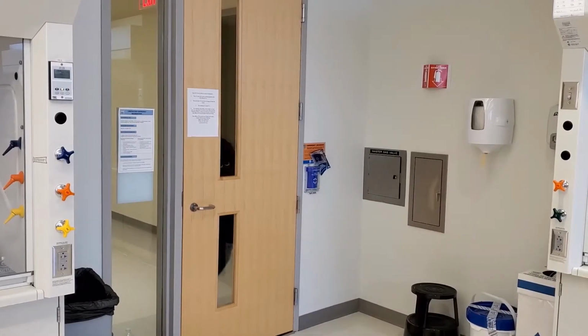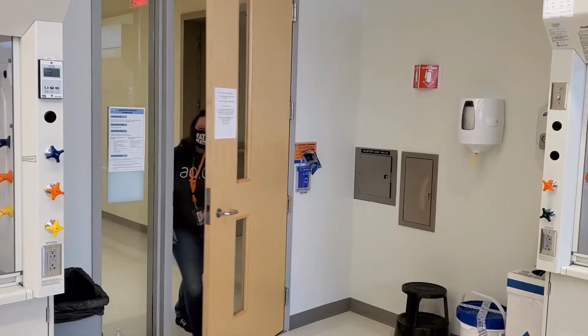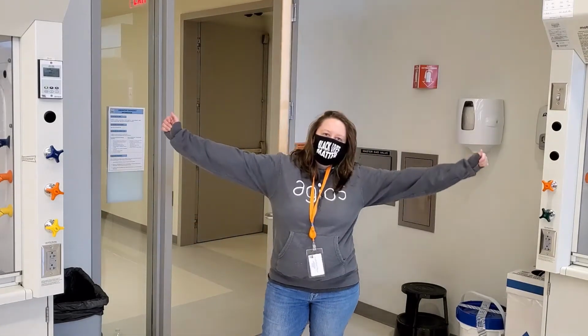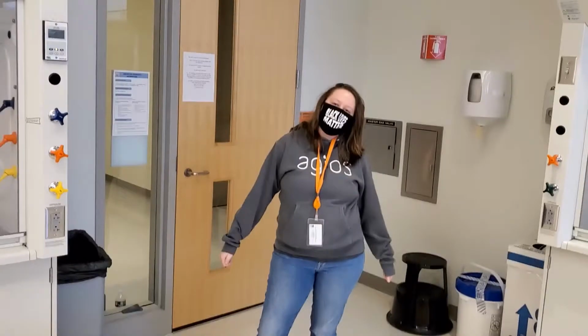Before we jump into today's lab, let's go over some general lab safety. Here comes a student that is almost ready for lab. She is wearing pants without holes in them and shoes that are closed toe. However, her hair is not tied back and she is wearing a long-sleeved sweatshirt that is not flame retardant or graded for lab chemicals.